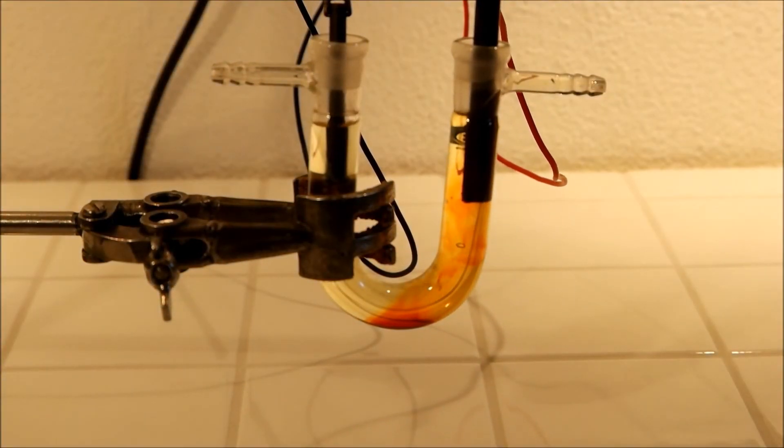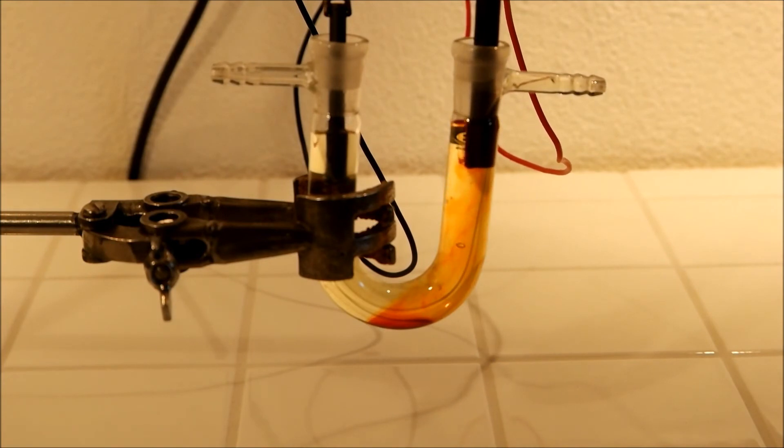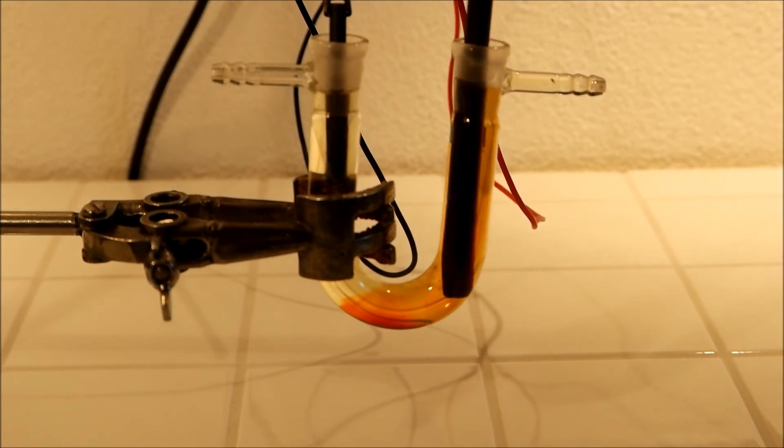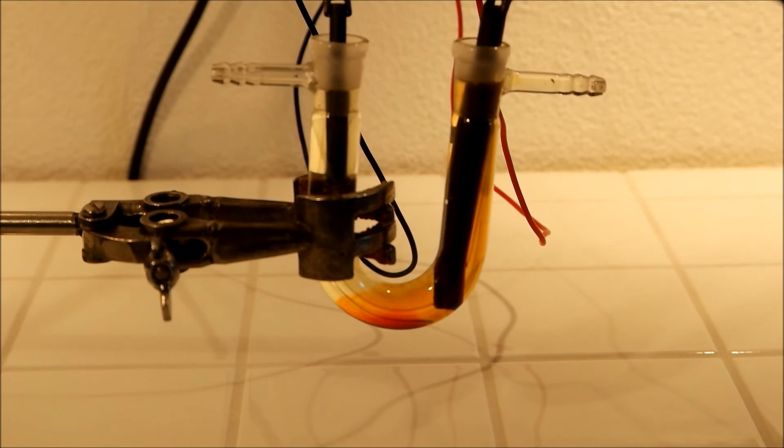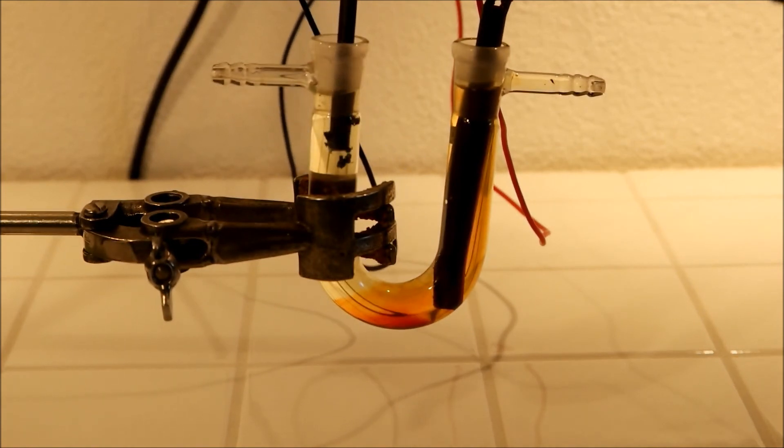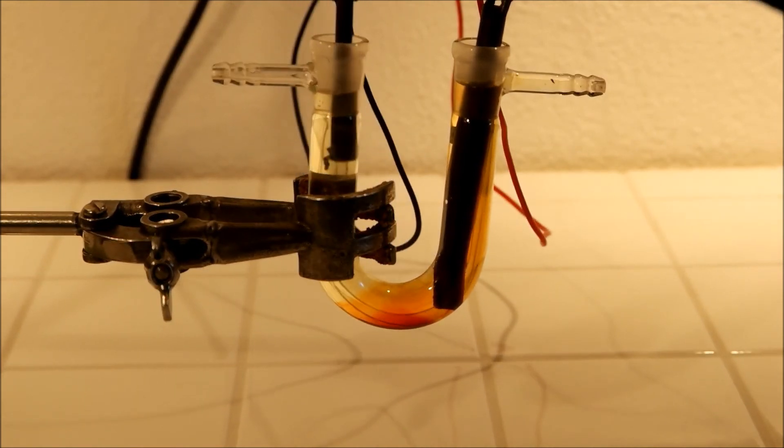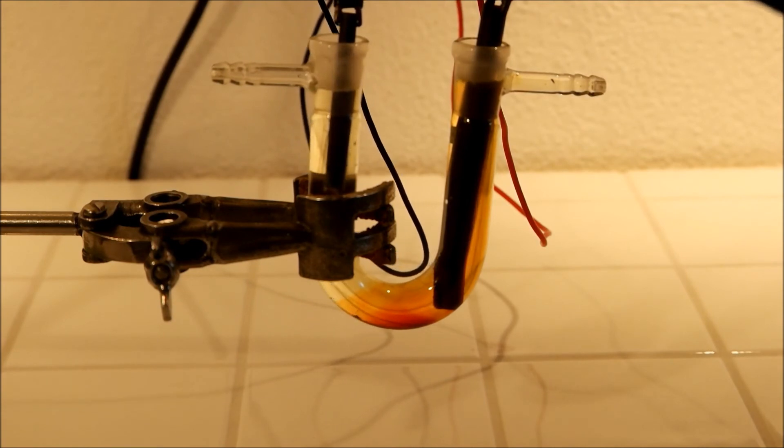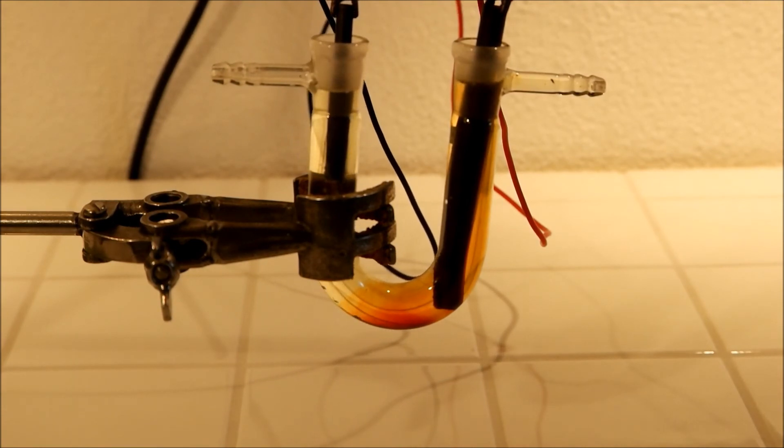There you can see the iodine. And here the zinc, the elemental zinc, and that's the electrolysis of a zinc iodide solution.